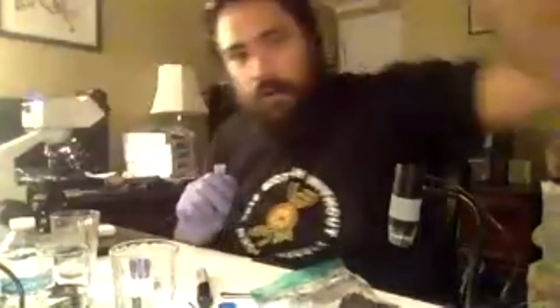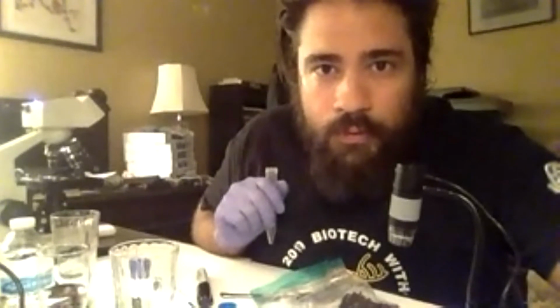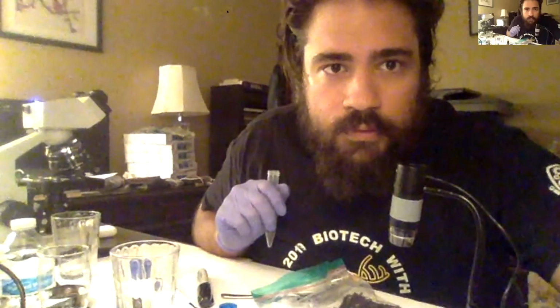All right, so I think I can stop sharing. Cool. So back to my webcam, and then I'm going to share my microscope. So I got my little dissection scope over. Cool, I got my little 1 gram of soil, and we're going to take a look at some of the detail of the soil. So let's look at the soil structure. We're just going to do a rough look, and then we're going to look at the dilution once we focus it in.